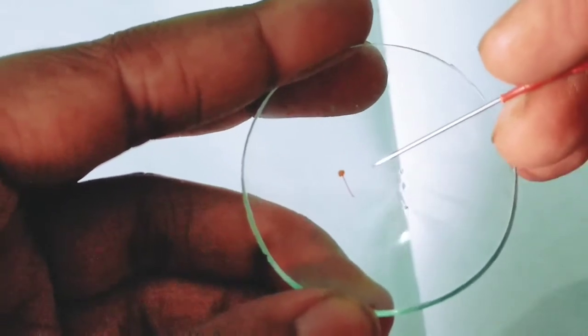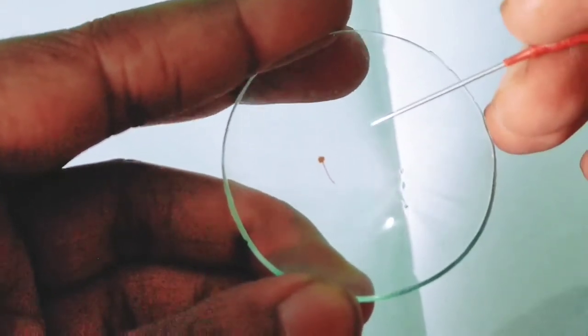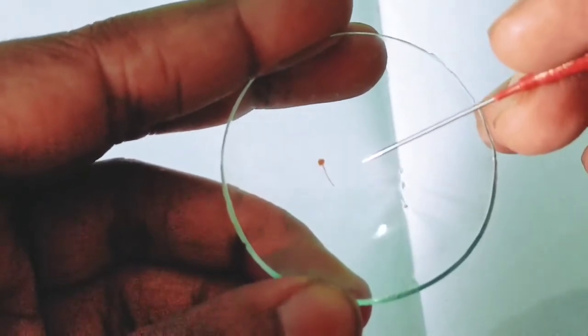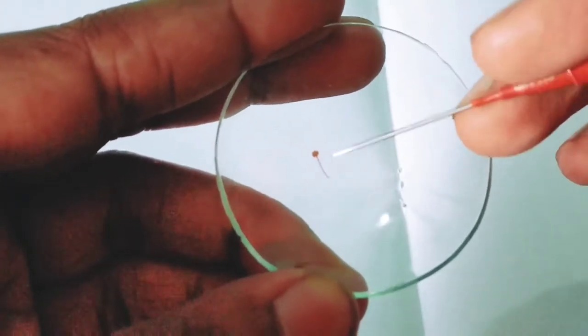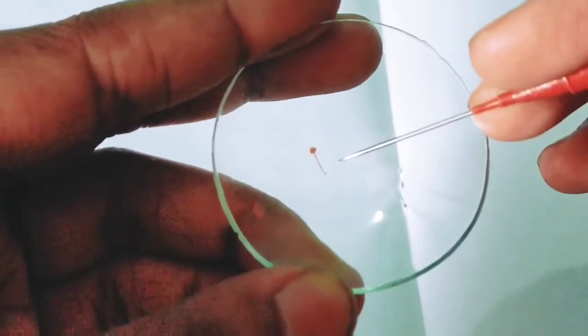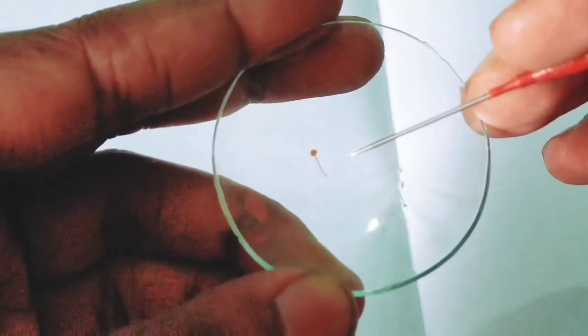In hibiscus, it is numerous in number. It is epipetalous, as it is united to the petal by its filament. The filament of it is free at the upper region.